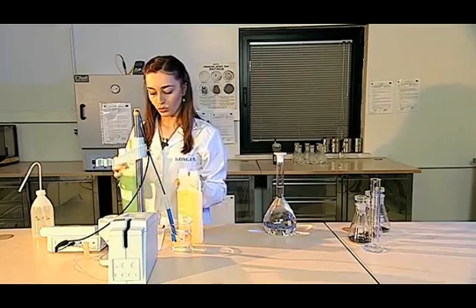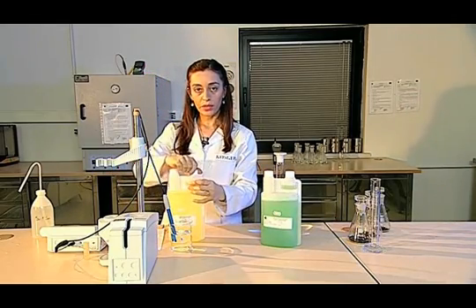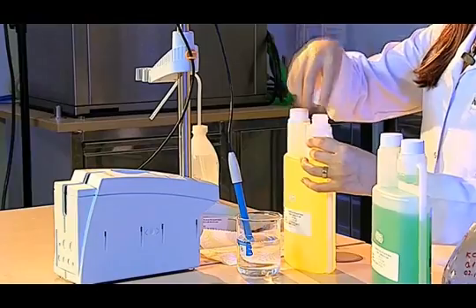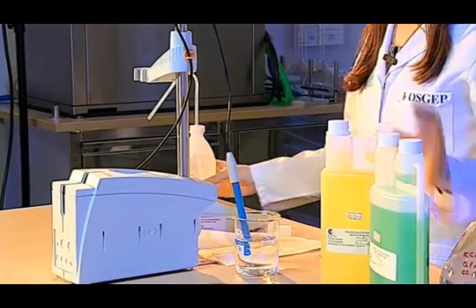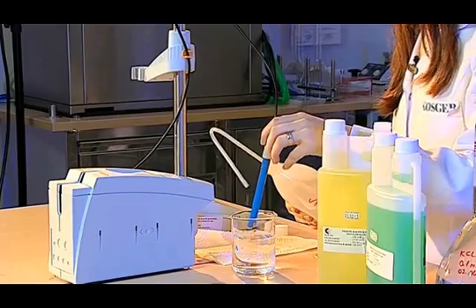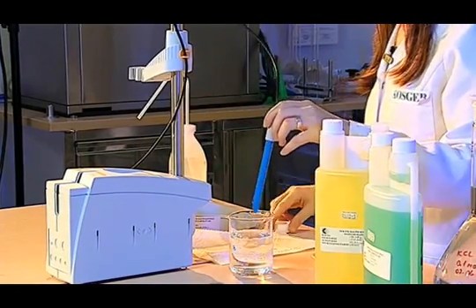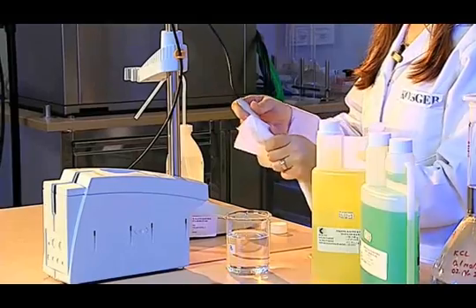Then I get the pH 4. The priority should always be given to the pH 7 in the calibration process, for this process provides neutralization of the pH meter. If our work range is with alkaline samples, then we use pH 7 and pH 10.